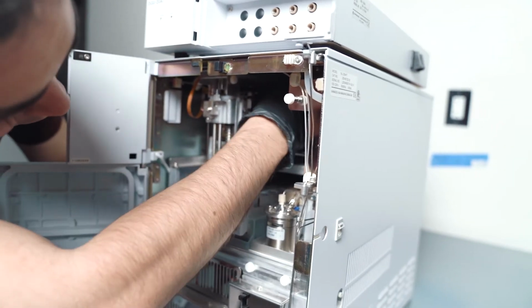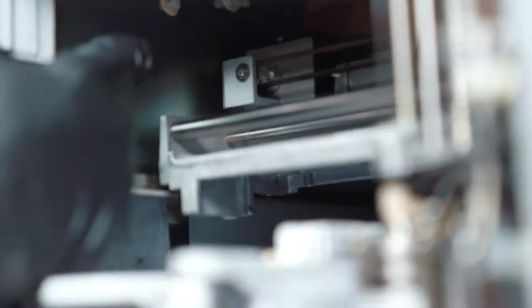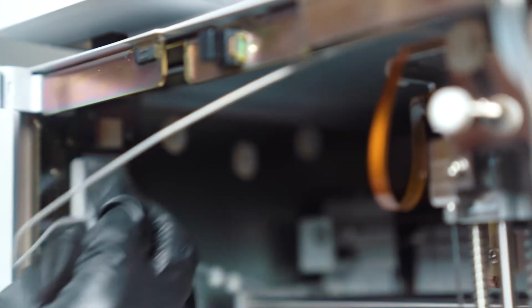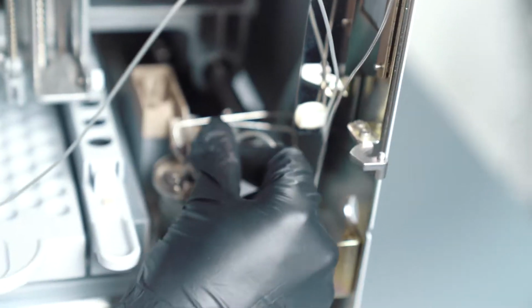So now you can take this off, pass it through the little rectangle to the back, and then move this to the side. You'll notice that there's 3 clips up here in the corner that you'll want to undo the loop from. This one is facing down, 2, and this is 3. Oh, and the 4th one here, 4 clips. And then there's 2 more clips here, 1 up here that you'll want to undo. This one is up. And then lastly, the one right here. And then lastly, you can unscrew the injection loop here with another one. So this is how you remove the loop.